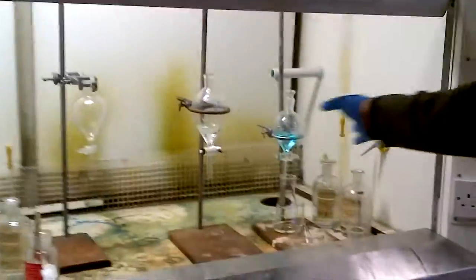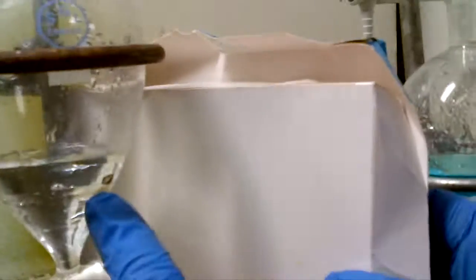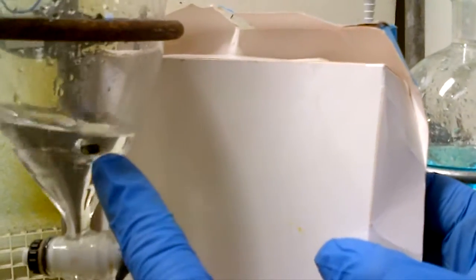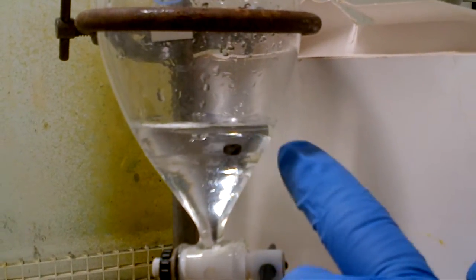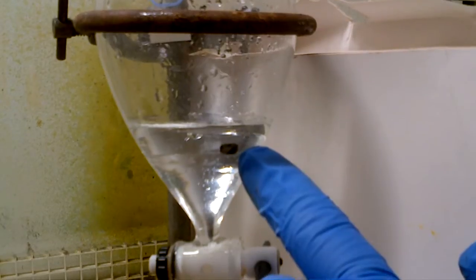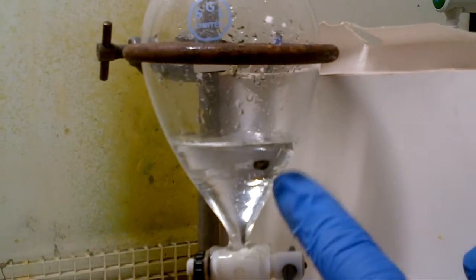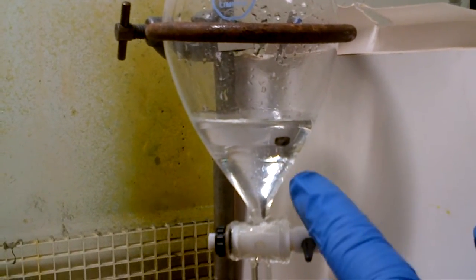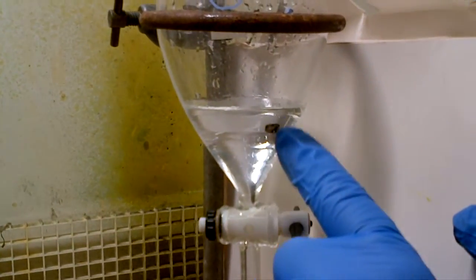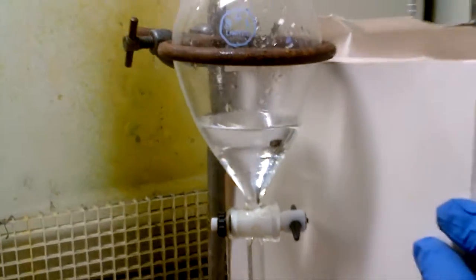And we'll just return back to this one, about the chloroform and DCM layer, look at this one, this is chloroform at the bottom, this is the top aqueous layer, so again, you need to be able to spot the two phases. Okay, so again, if it doesn't settle out, put some brine in, however as a solution, or sodium chloride solid, give it a swirl in the funnel, let it settle out, DCM chloroform bottom layer, aqueous top. Okay, and that concludes our little video clip.